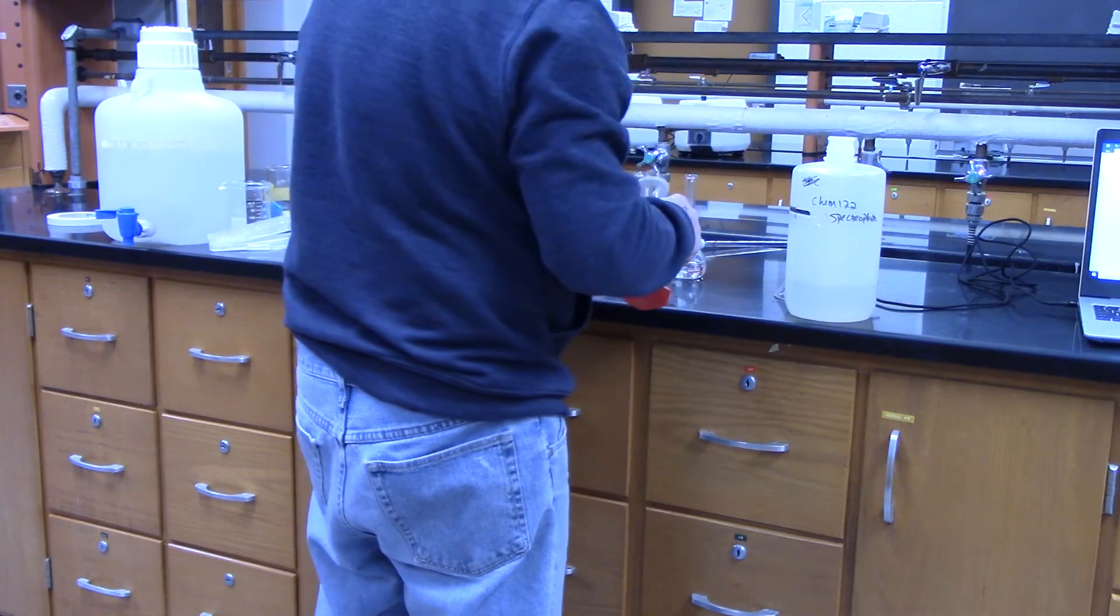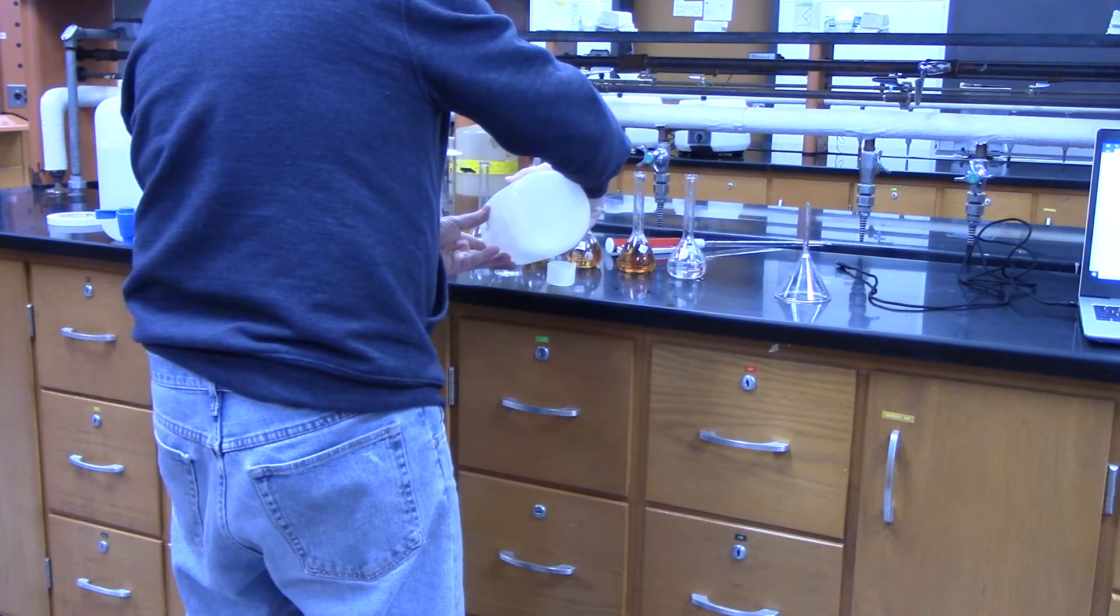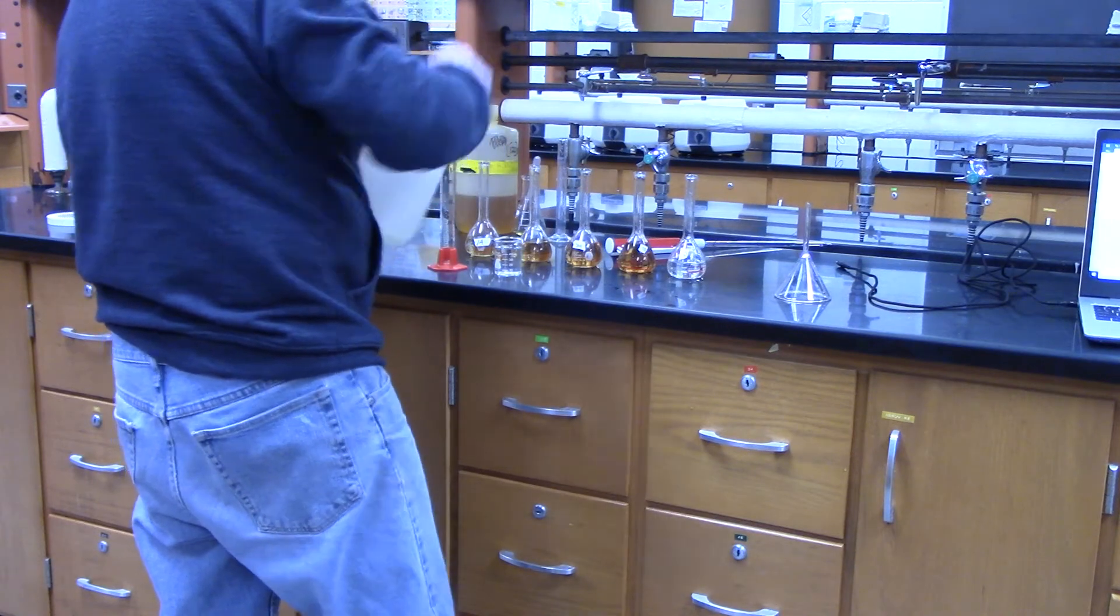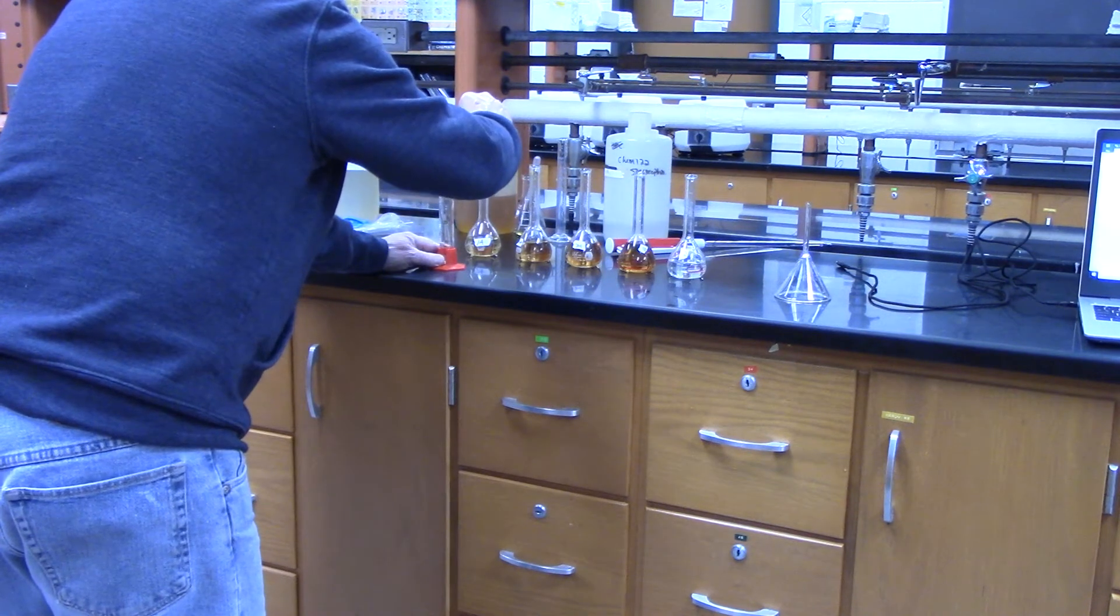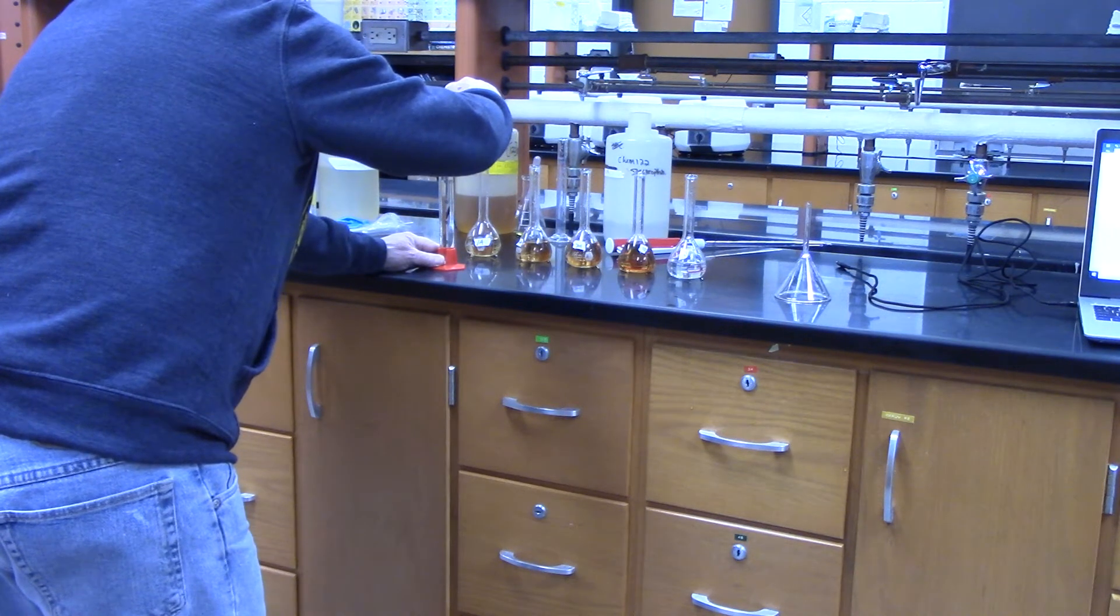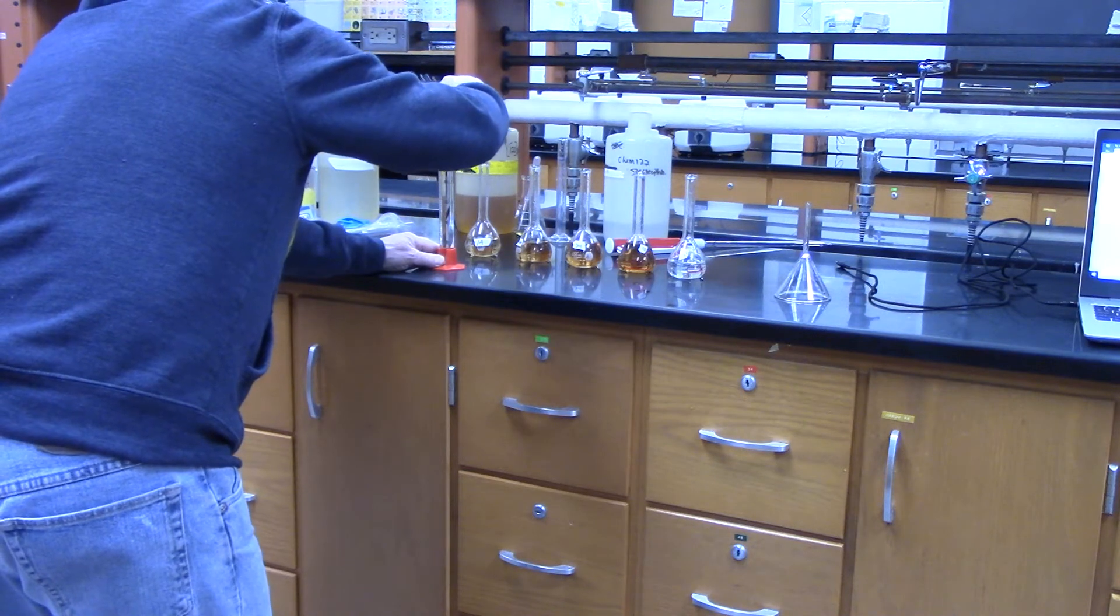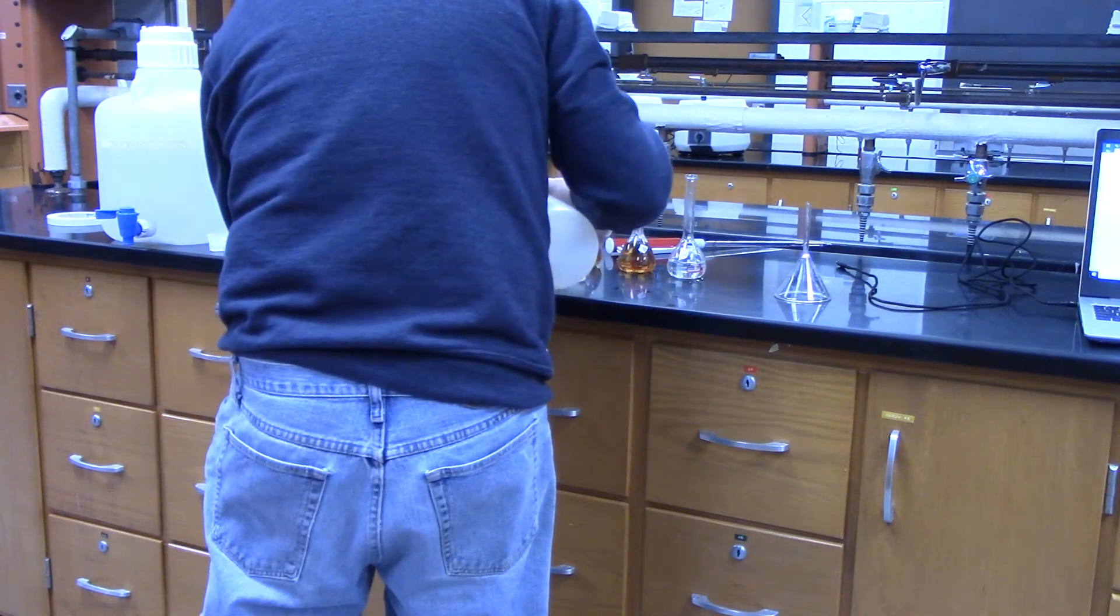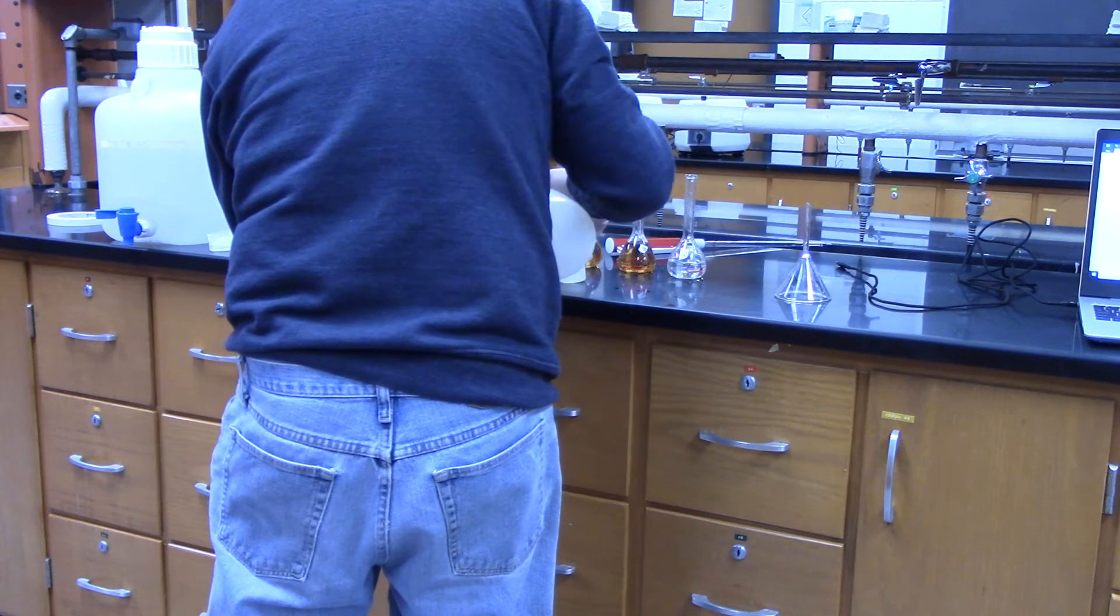40 mils and then the last one is 50. You can see that the color change progressively gets darker. Just add a tiny bit more.